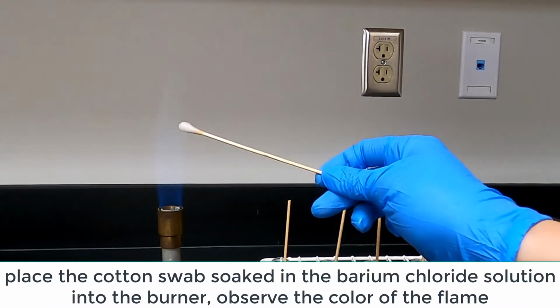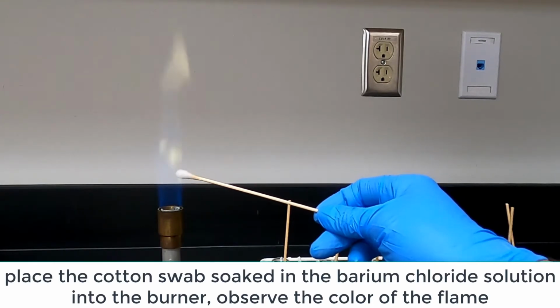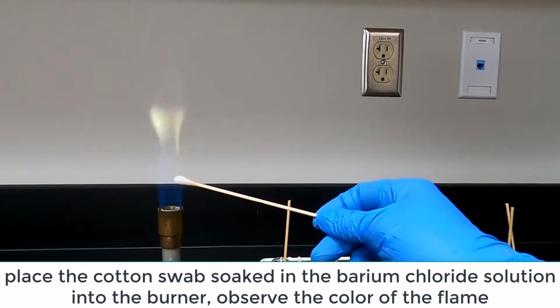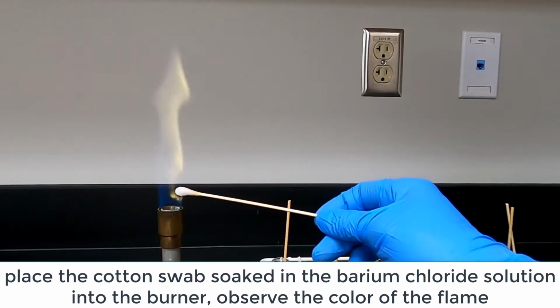Barium chloride, record your observations on the datasheet.